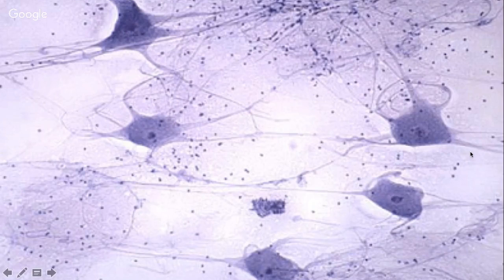In the Atlas review video, it talks about how unless it's really specific and asks, okay, this structure delivers neurological signals from the neuron to the rest of the body, then you can call it an axon. Or if it says, this structure delivers neurological signals from the body to the neuron, then that's a dendrite. But unless they give you that information, you can't really tell which one's an axon and which one's a dendrite. You'd be guessing on that. And then the other thing in this slide that you'll need to be able to identify are all these little dots right here, which are neuroglia, or neuroglial cells.